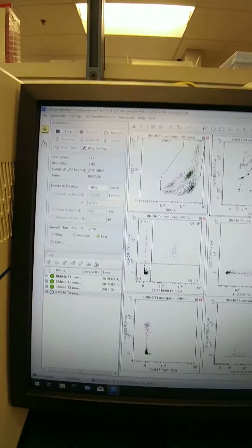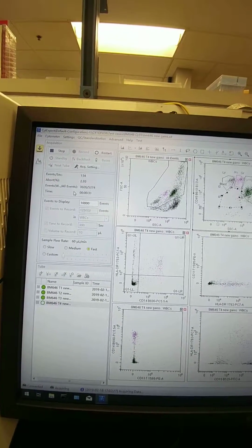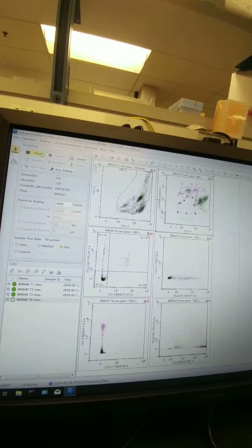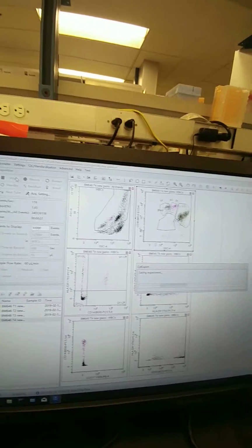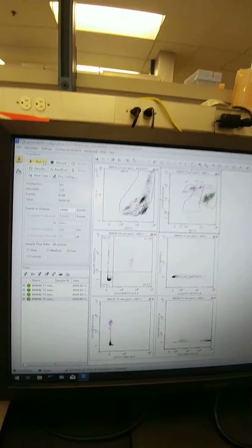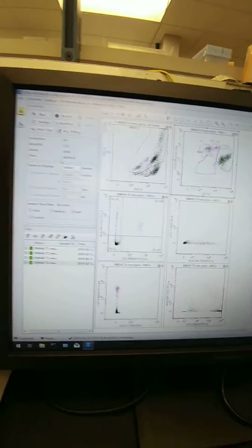And this one I accidentally almost ran dry earlier, so we're not going to get as many events as quickly because I had to add more PBS at the end. And so we're going to hit stop. Okay, so the next thing I'm going to do is load these into the Kaluza template and analyze them, and I'll discuss with Steve what settings he likes better. And then we can update those from there.